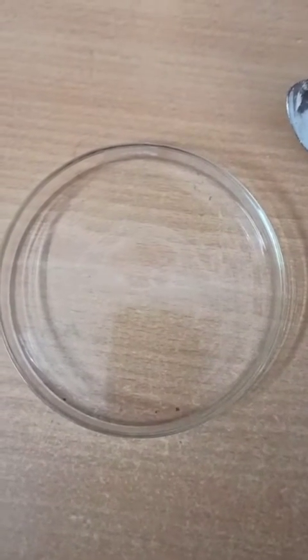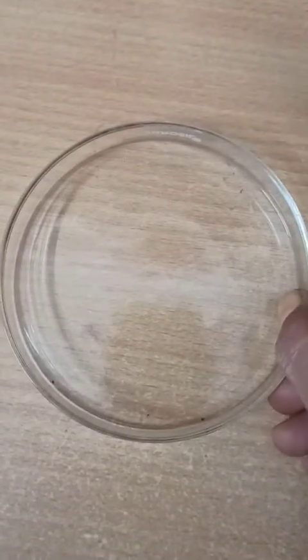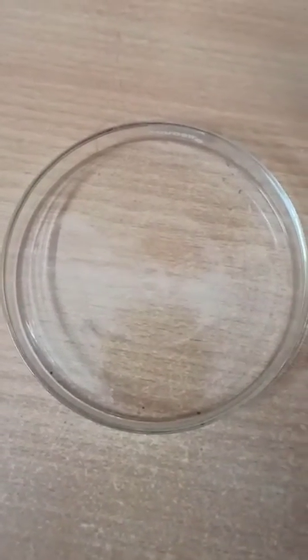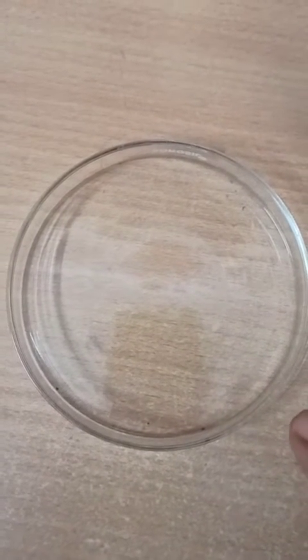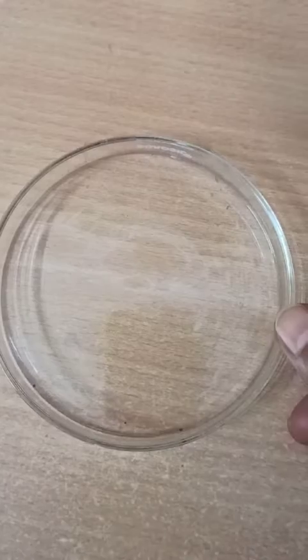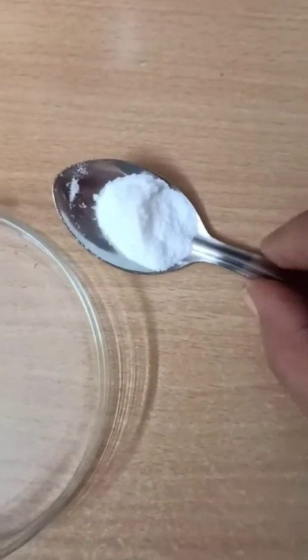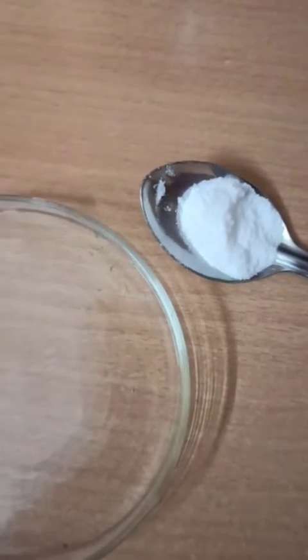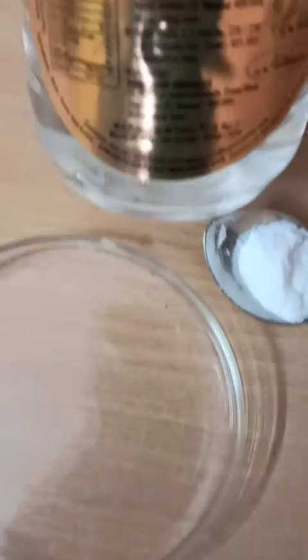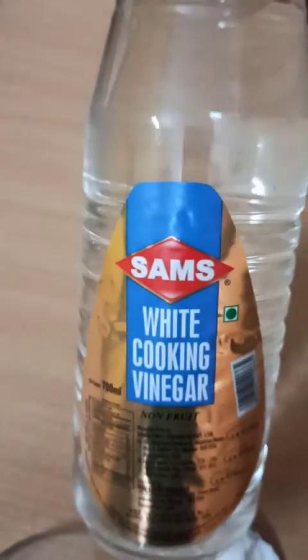Now you can see I have this petri dish which is made of glass and generally we use it for practical purposes — it is always available in our lab. I have this baking soda in this spoon.